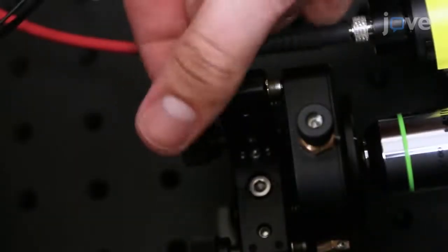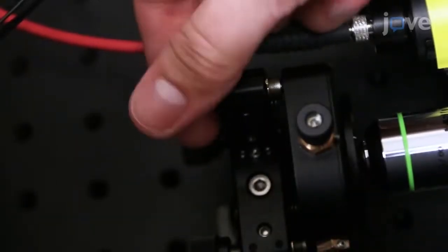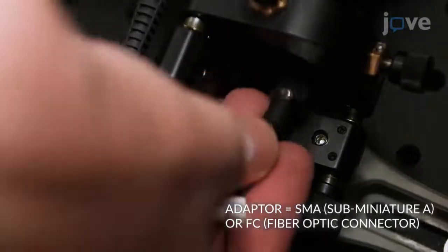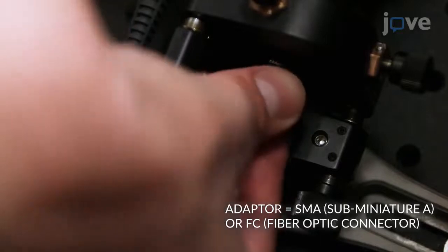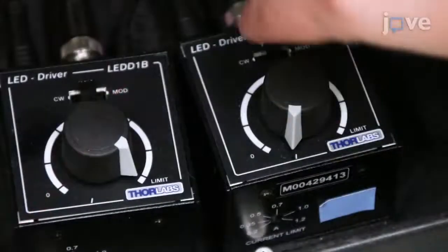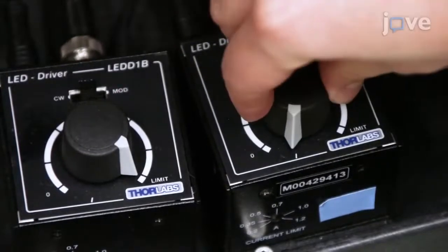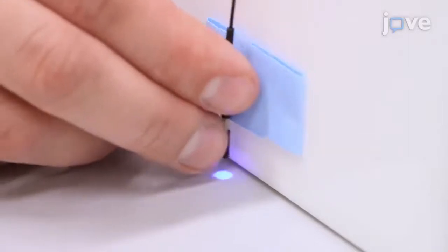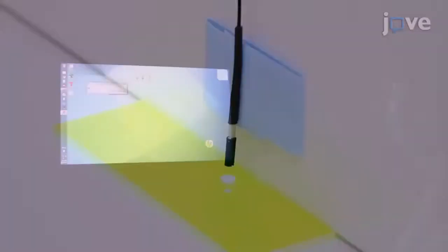Begin by loosening all screws on the 5-axis translator. Screw in the patch cord to the adapter that is affixed to the 5-axis translator. Then, turn on the 470 nm excitation light at low power and position the tip of the fiber pointing to an autofluorescent plastic slide. Next, record from the complementary metal oxide semiconductor, or CMOS, camera in live mode.